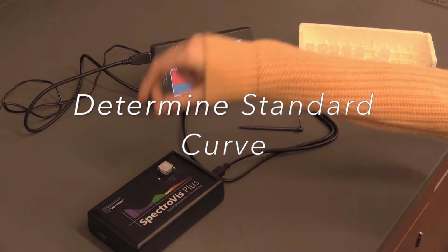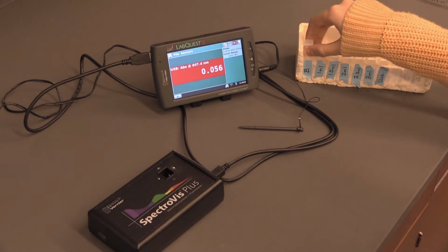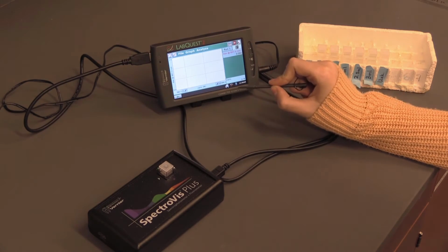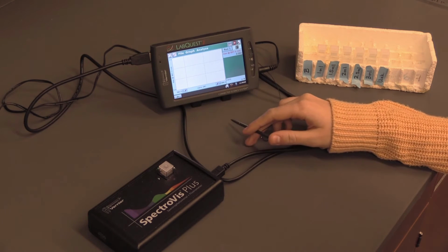Take your higher concentration cuvette out. Under Graph, Analyze Mode, place blank cuvette in cuvette holder. This will be your first standard sample at concentration 0. Click the green arrow to collect.